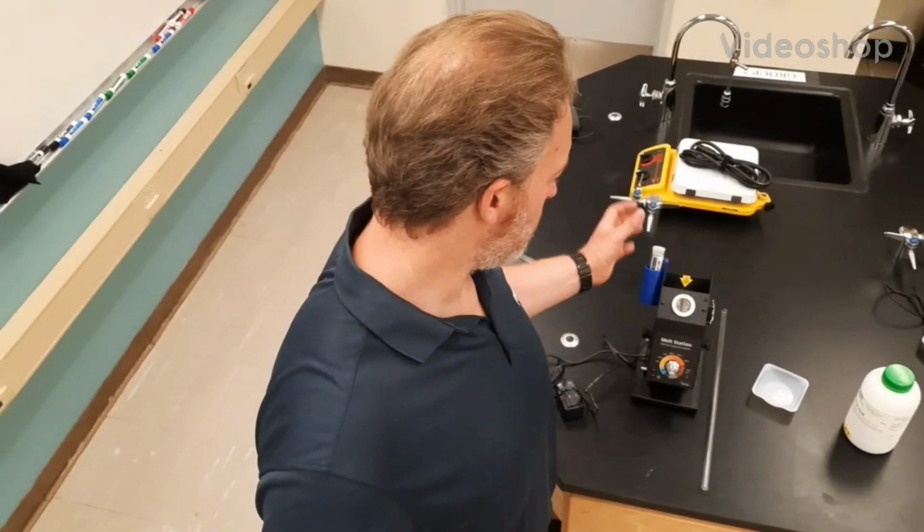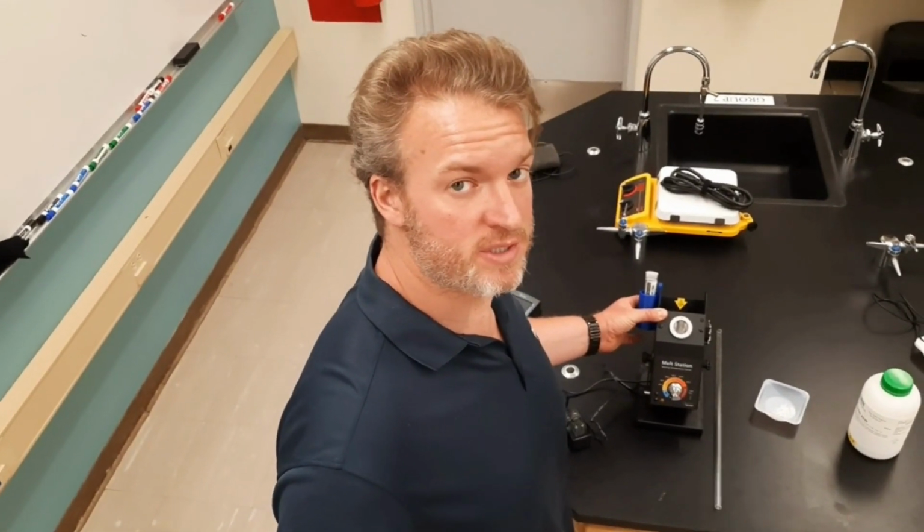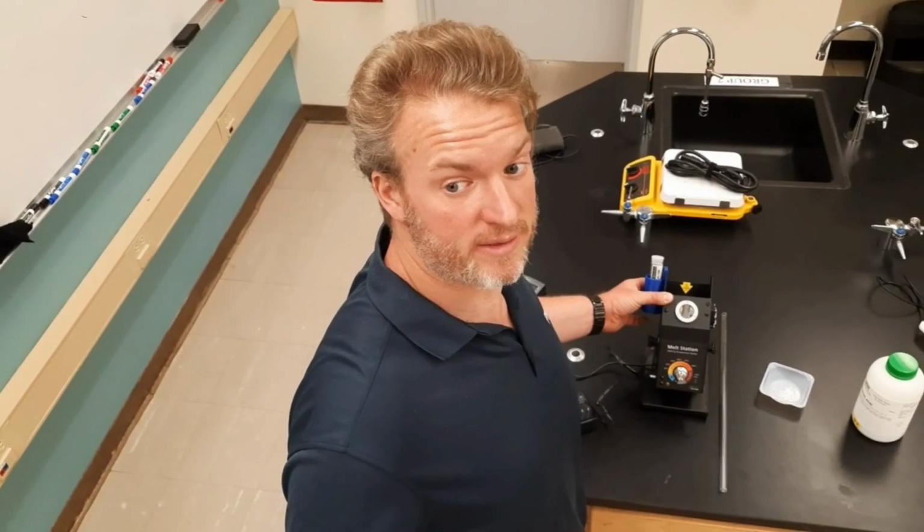Hello, you absolute legends. My name is Don Cavanaugh, and today I'm going to show you how to use the melt temp station to determine the melting point of substances in chemistry class or anything.